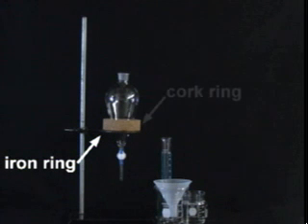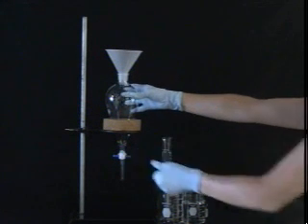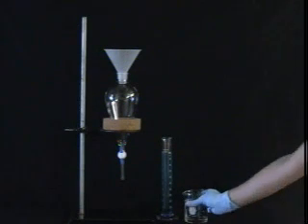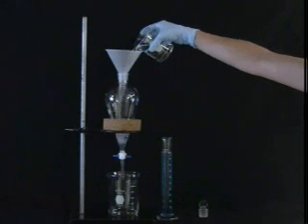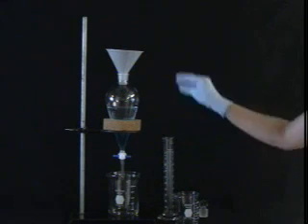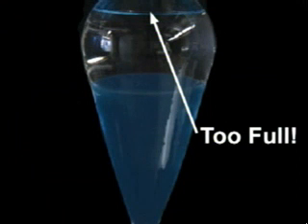The first step in an extraction and washing sequence, once you have decided on the appropriate solvents, is filling the sep funnel. It is a good idea to use an iron ring and a cushy cork ring to safely support the sep funnel. Before you add any solvent, close the stopcock and place a clean, dry flask under the sep funnel. This will prevent you from dumping precious material all over the dirty bench — the flask will save you if the funnel leaks or the stopcock somehow opened itself. When the stopcock is safely closed and the flask is in place, pour your two solvents into the sep funnel. Use a sep funnel large enough that you don't fill it more than three-quarters full; if it is too full, you won't be able to efficiently mix the solvents.